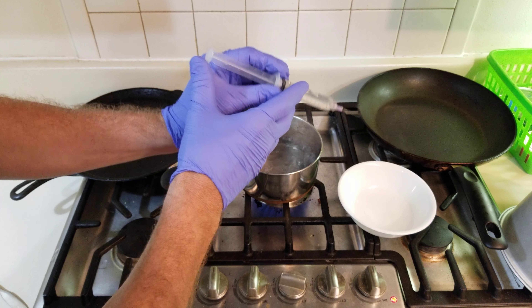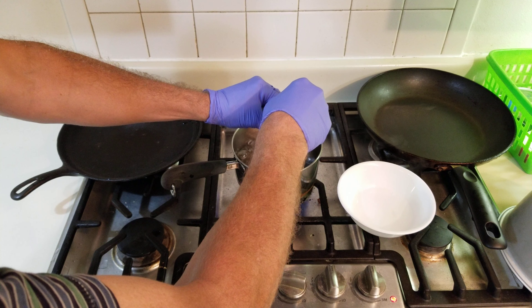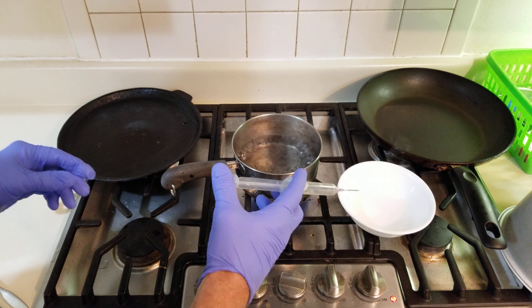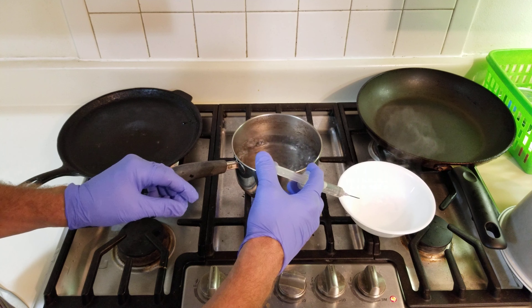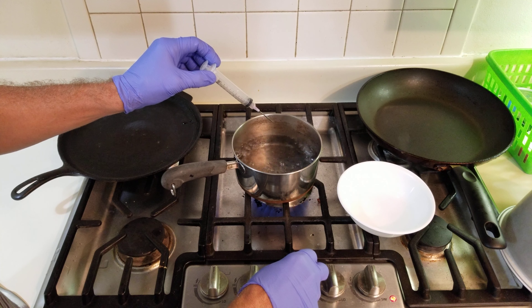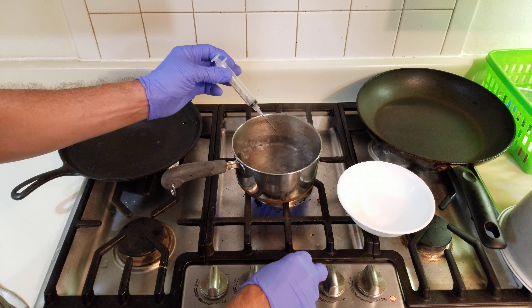It's okay at this point. This will be the last one. If you squirt it out, we're going to take some water — and this is going to be the water we use to make the spore solution. We're going to mix it with the spores. So this needs to be completely sterile from this point on.